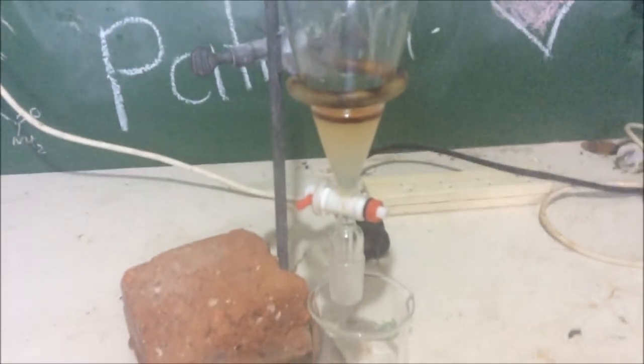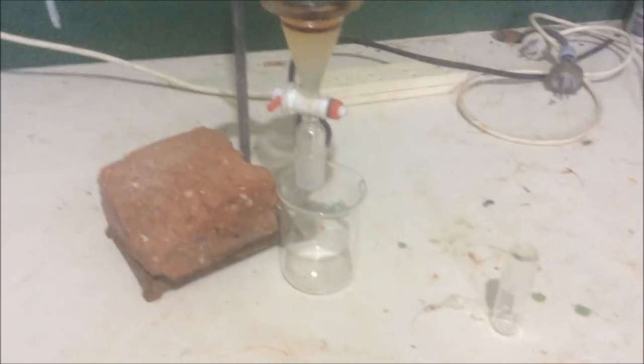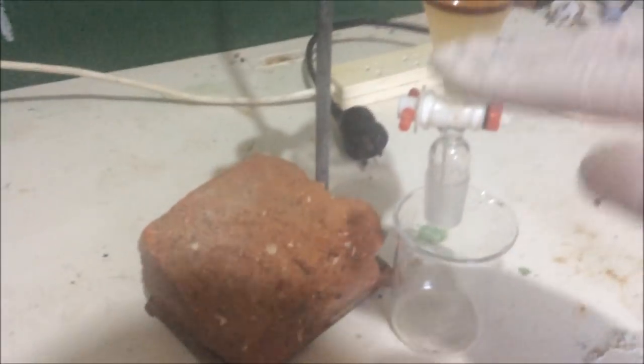All right, just added some salt water and did the whole shake and vent thing. I know we're redistilling it, but I just wanted to see if I could wash out that orange color at all, but I can't. And the salt water will help drag away any water that's left in the benzene.